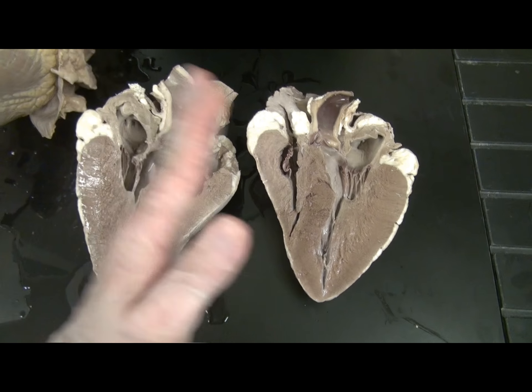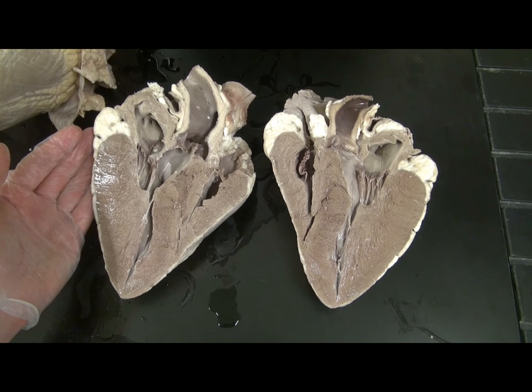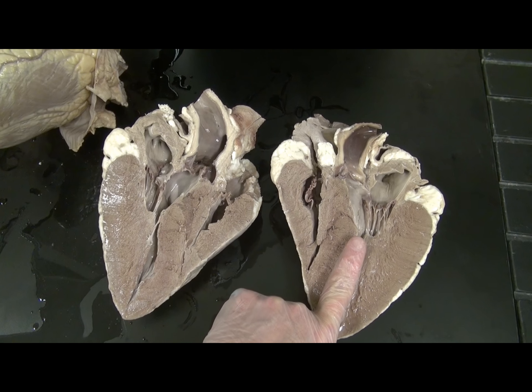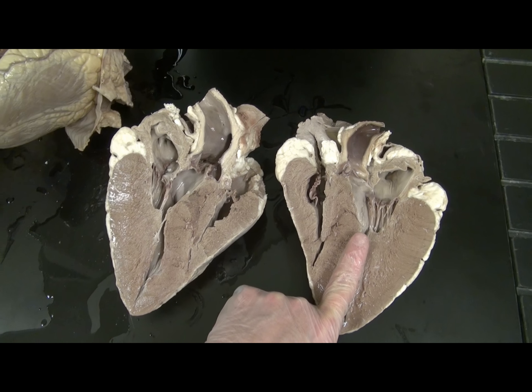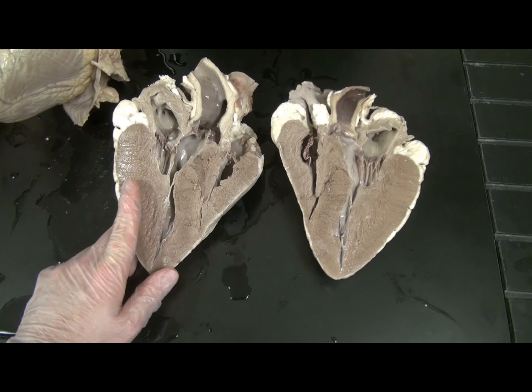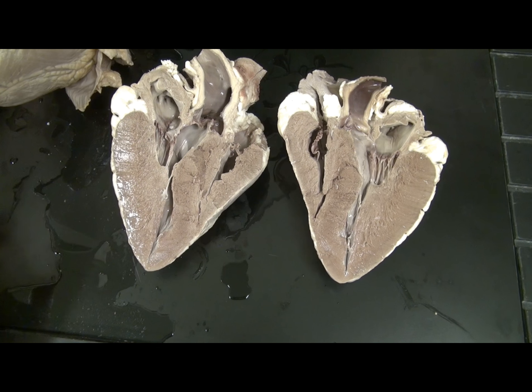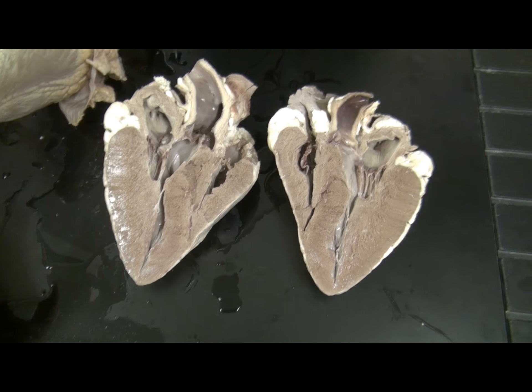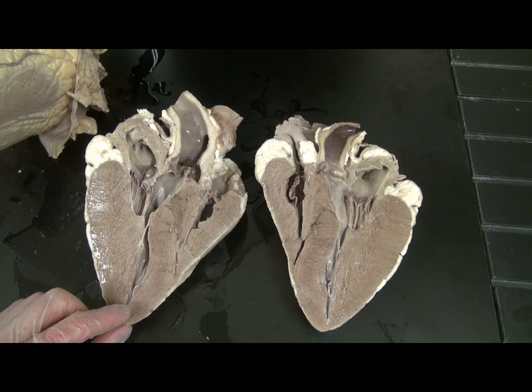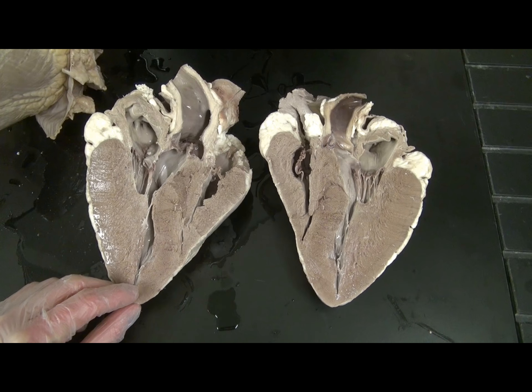Note that when we do a frontal section, the left ventricle is on the right-hand side on one of the two sections and on the left of the other. So it is not called the left ventricle because it is on the left, but rather because it has the thickest wall and makes up the apex of the heart.